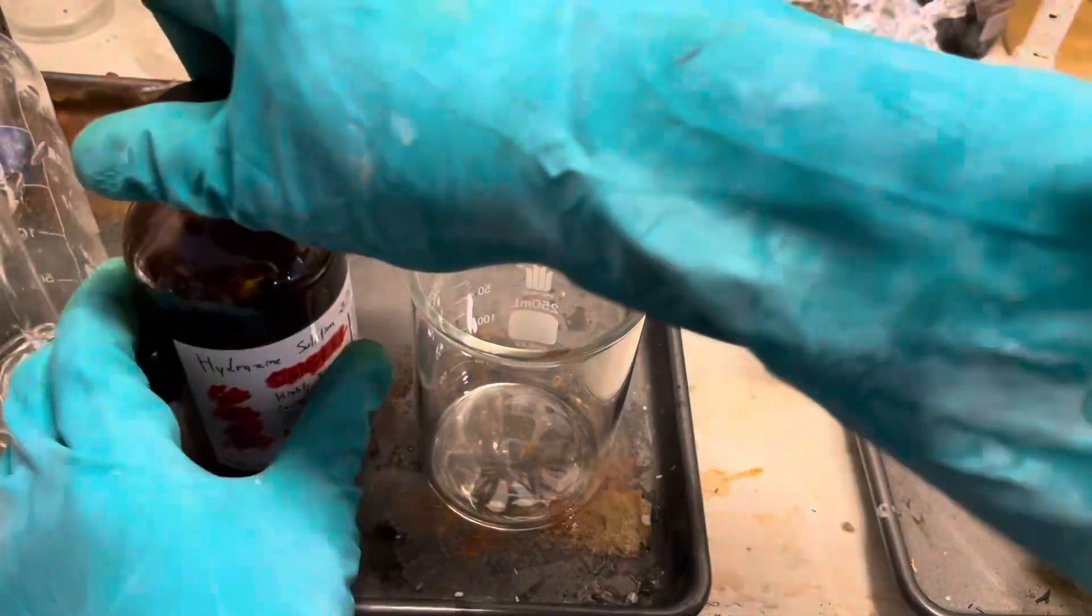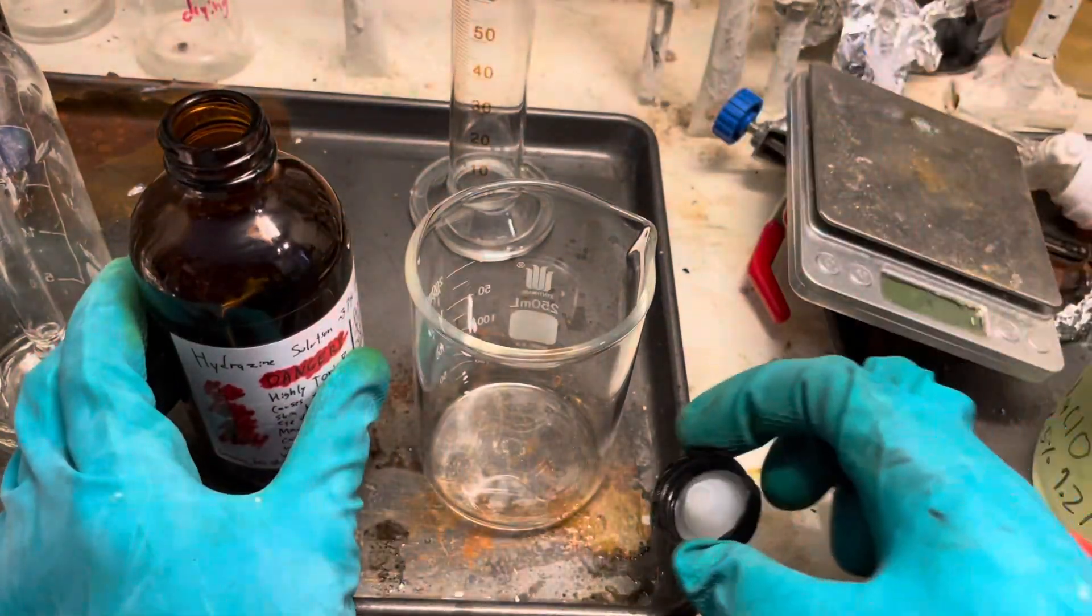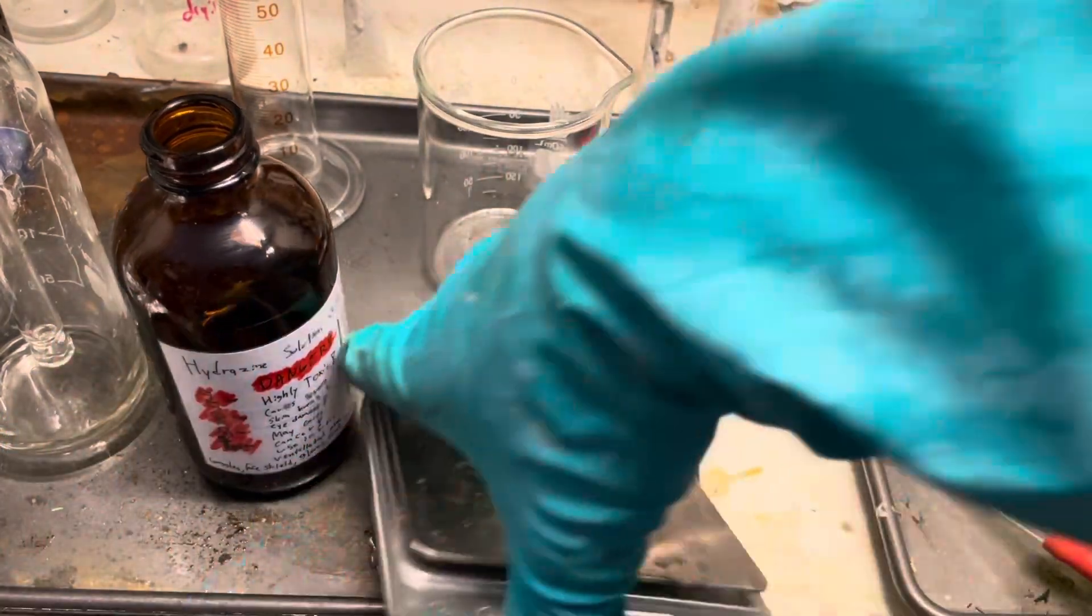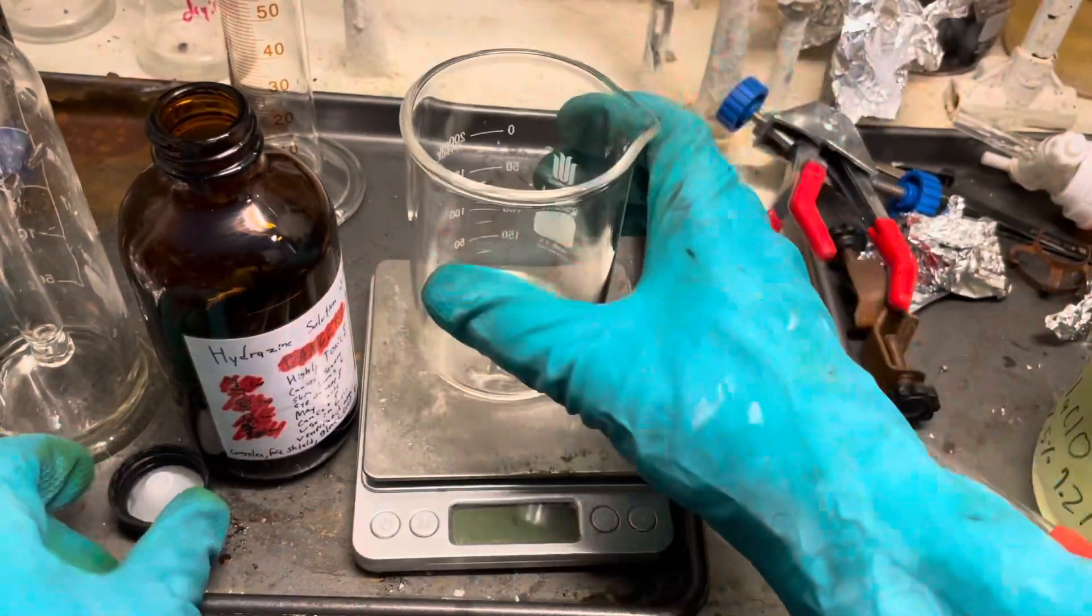We're going to titrate it using bleach because that's very simple. Of course this is not the best way - the best way would be using iodine or something like that, but frankly I don't care. This is ballpark figures again, just a rough idea of concentration.